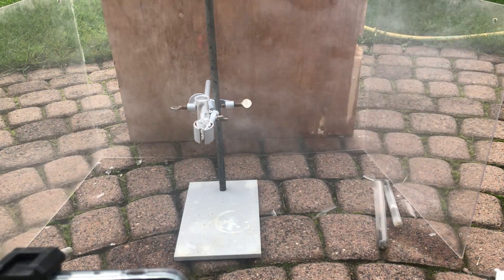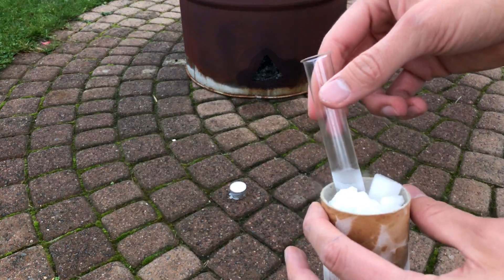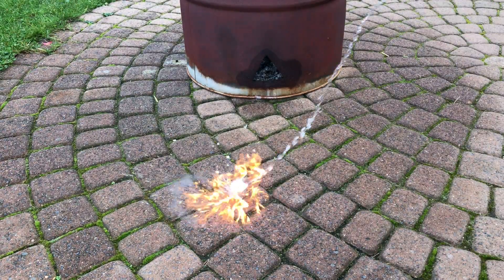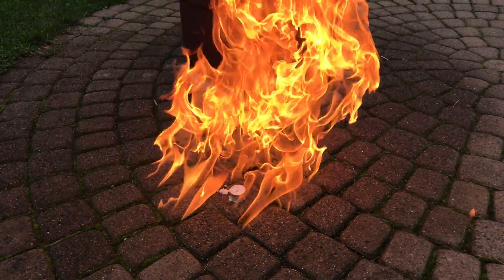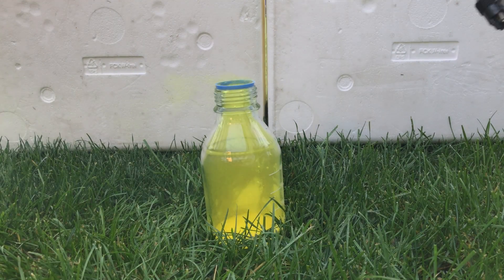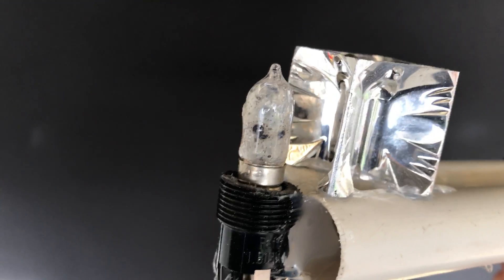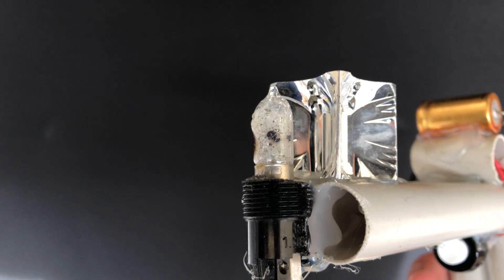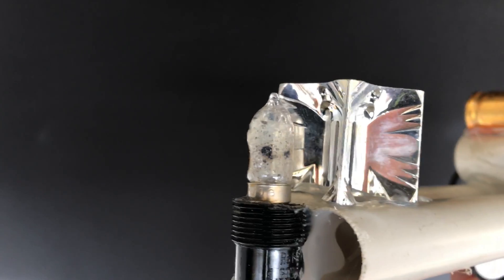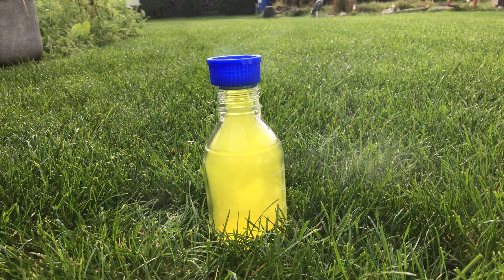That was more violence than I expected. I had planned to do the same with liquid butane, but after seeing what happened with the MTBE I decided to just burn it instead. I also tried to initiate the decomposition of chlorine dioxide with light, using a light pistol containing a light bulb filled with a very thin magnesium wire and pure oxygen from an old photographic cube, but it didn't want to ignite the chlorine dioxide. Even UV flashlights failed to get the job done, so I reverted to old school and threw in a match.